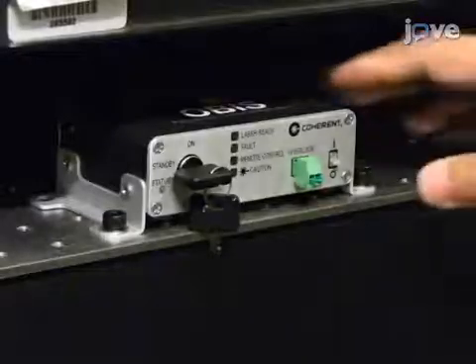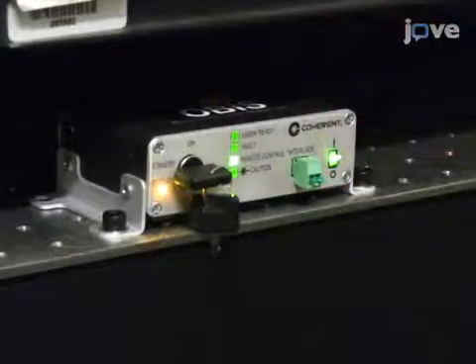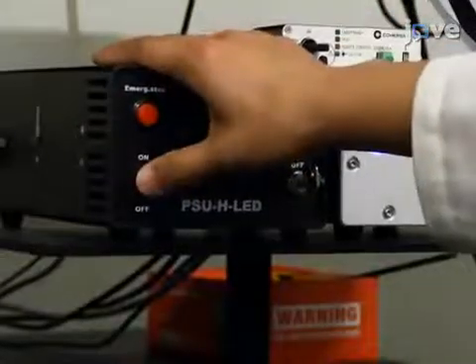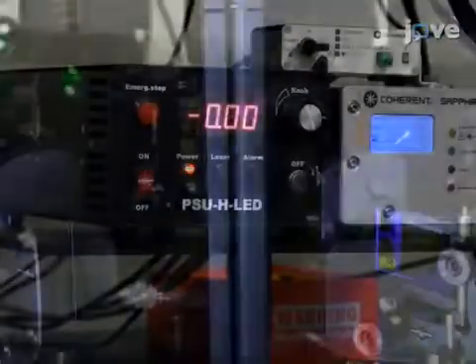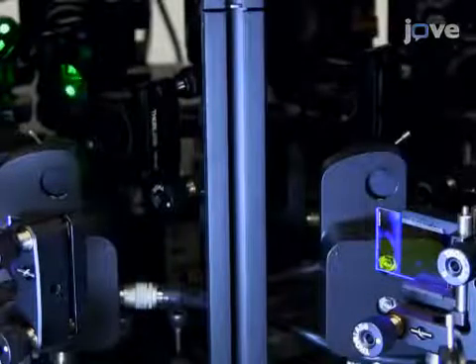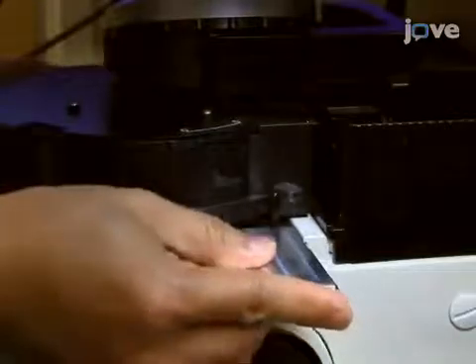Approach the microscope and power on the 405 and 561 nanometer lasers. Keeping the shutters closed at this point, ensure the 561 nanometer dichroic mirror and notch filter are in place.